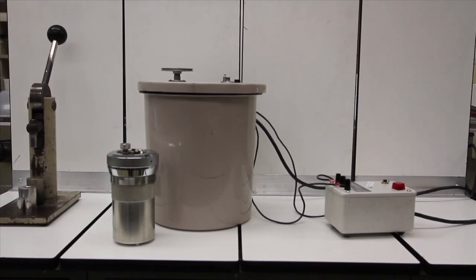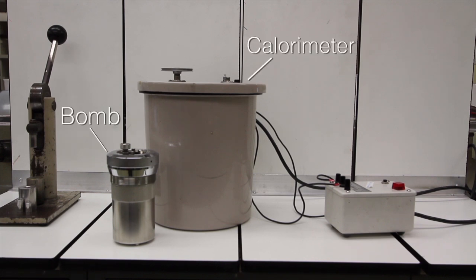This short video will demonstrate how to properly prepare a bomb calorimeter for analysis. There are two main parts to a calorimeter: the bomb and the calorimeter itself.